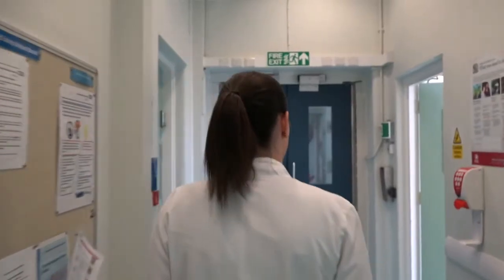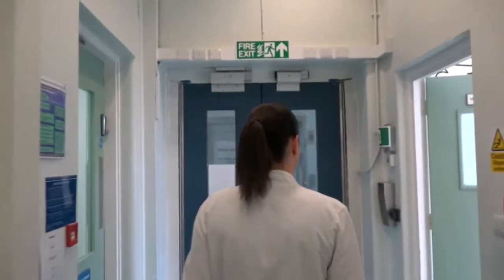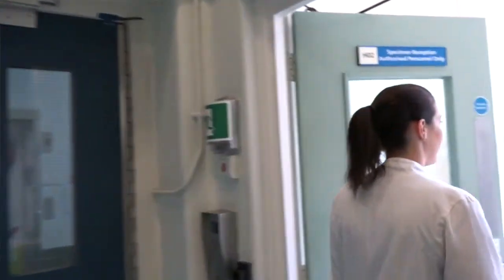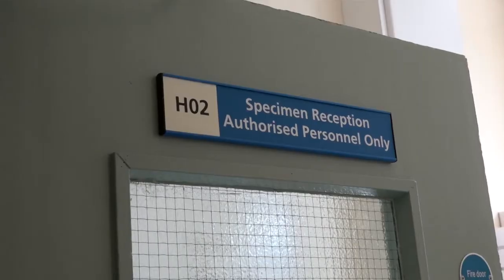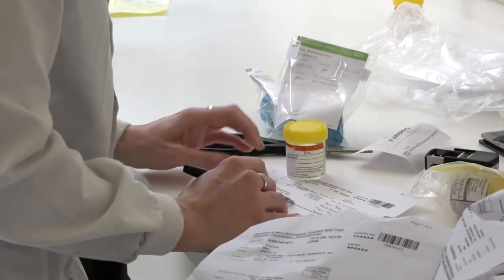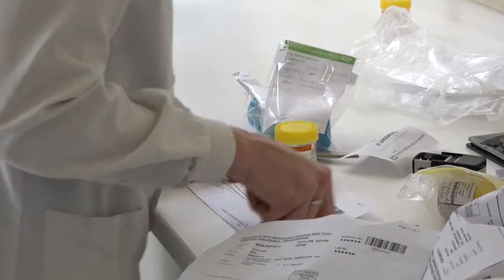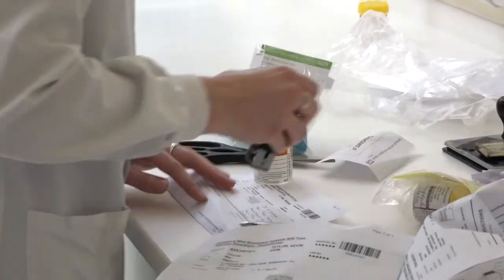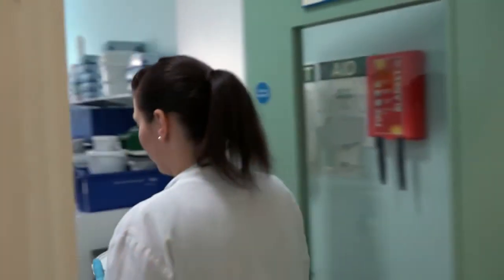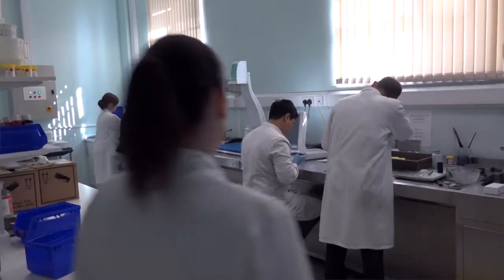The specimens we receive are brought to us from various wards within the hospital via porters and also from our local GP surgeries. Once the specimen has been booked in, it gets brought through to what we call the trimming room.